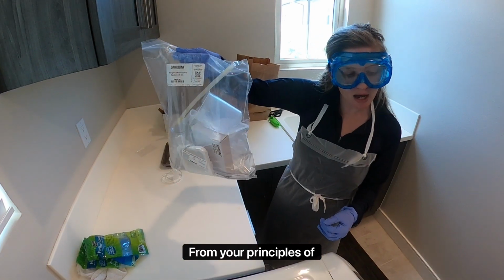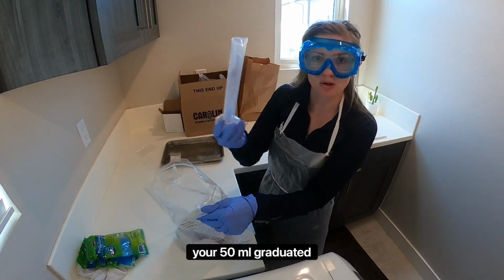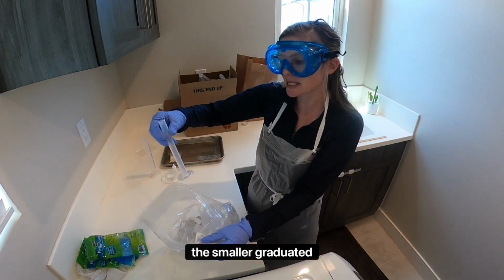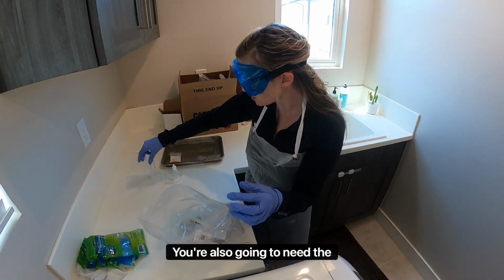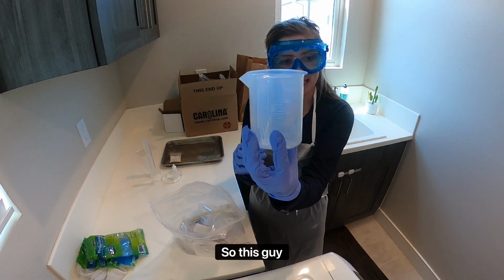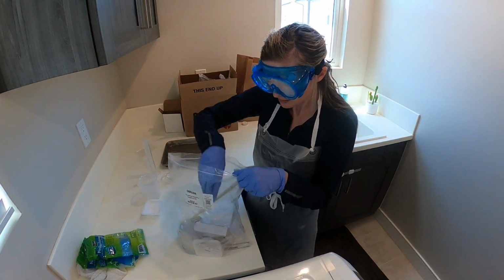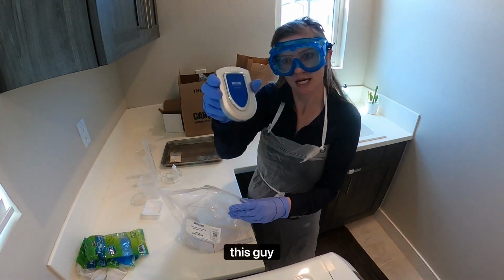From your Principles of Chemistry equipment set, what you're going to need is your 50 mL graduated cylinder, so that's the big one. You're also going to need the smaller graduated cylinder, that's the 10 mL, so it looks a little bit like that. You're also going to need the big plastic beaker, the 250 mL beaker, so this one here. Also, you'll need a weigh boat, so one of these, as well as your digital scale, this one here.